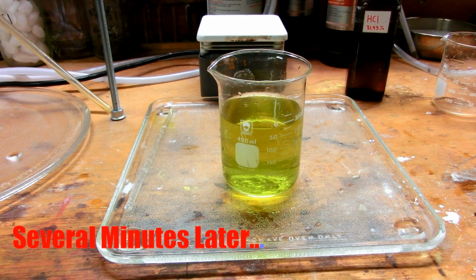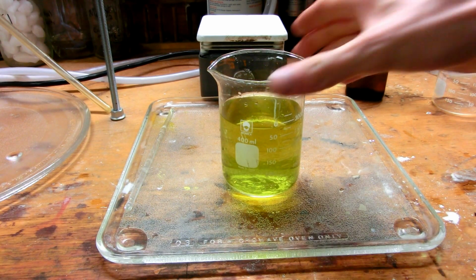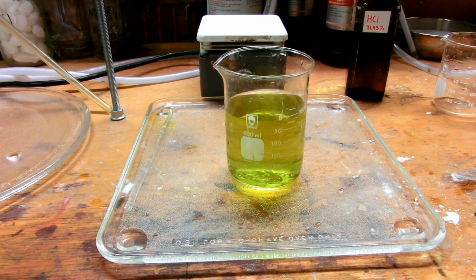Okay, so here's experimentalism for you. Upon standing for several minutes, you can see that there's absolutely no precipitate forming. We just have a yellow solution. And my solubility data for iron oxalate says that less than 1,000th of a gram is soluble in water at 20 Celsius. So either my solubility data is inaccurate, or the hydrogen chloride that's left in solution, or the hydrogen chloride that's produced during the reaction, is keeping it in solution for some reason.